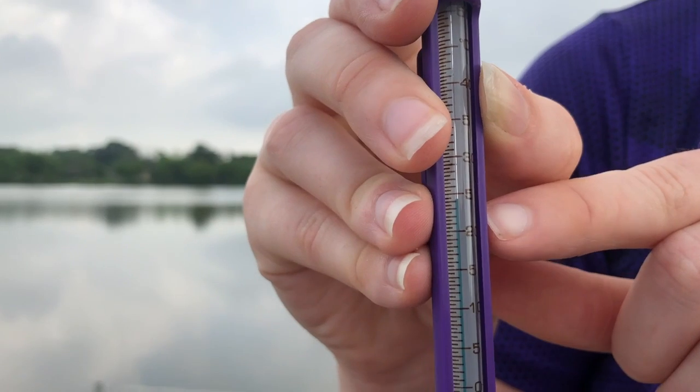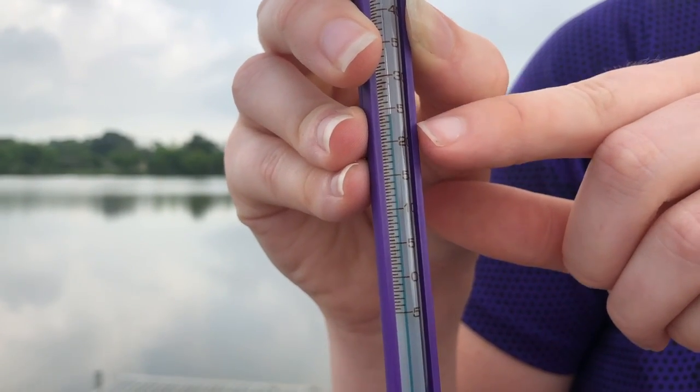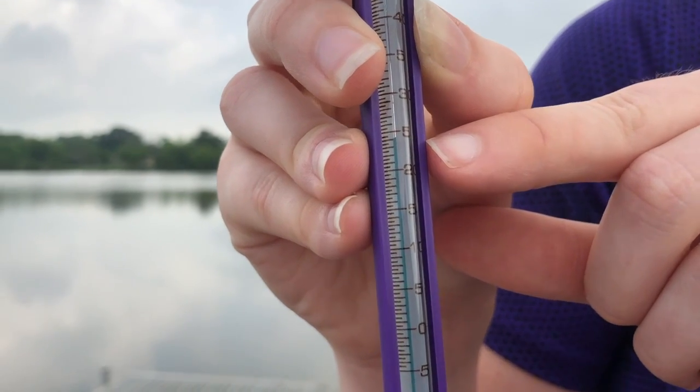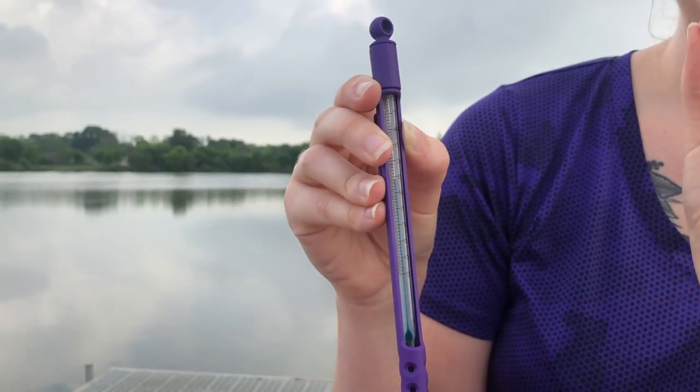But actually, it looks to be about 24. So if we count down 1, right where it lands at that little line, that means it's 24, because it's one little line below the 25. And if it was a little bit further down, it might be 21, or if it was under 20, it might be 19 or 18, depending on where it lands by those little lines. So that is how we're going to read our thermometers. They don't always travel by 5s, but this one does.